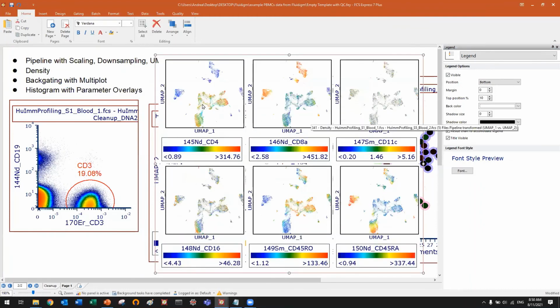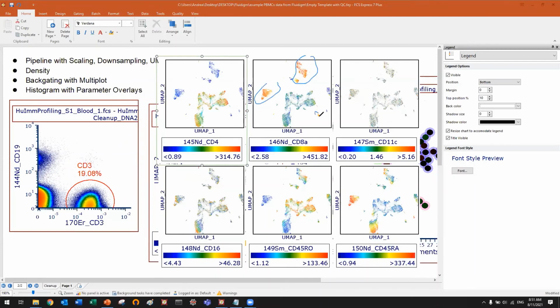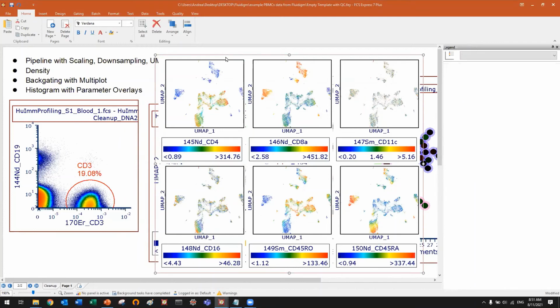So I can, for example, from the second plot, clearly see that CD8 are here, here, and here. Those are all different CD8. And CD45RA are here, here, here, here. And so on, and so on. So this is one way of doing this type of stuff.